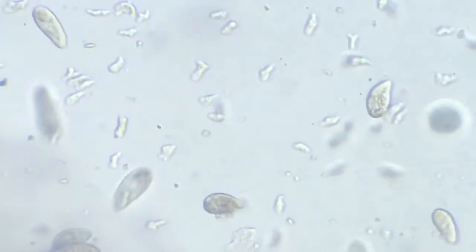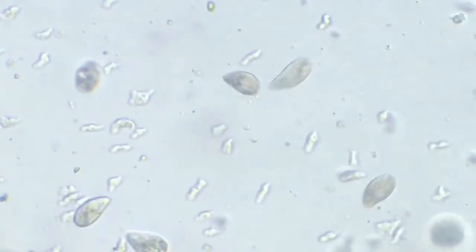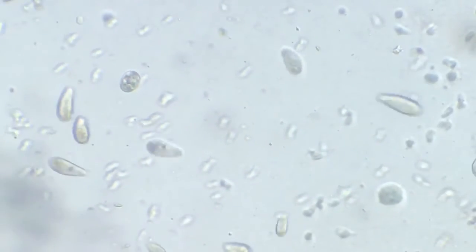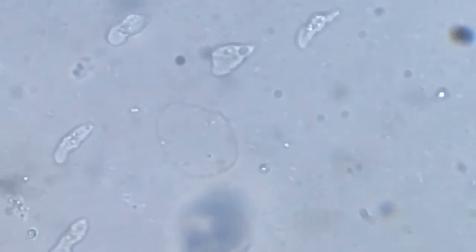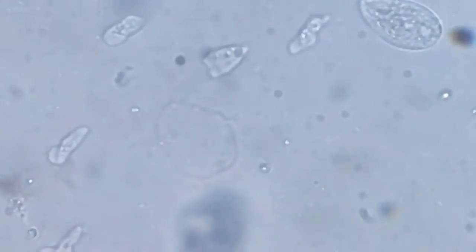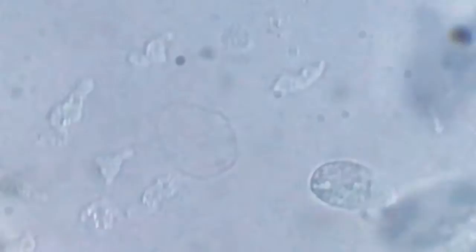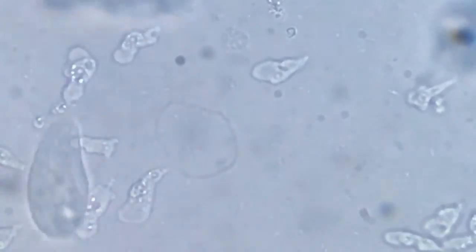So we'll just focus on the amoeba because they look very fascinating and exciting, and see if we can find something worth watching. So we go to the higher magnification now. Need to zoom in, rather focus in fact. So here we have focused and then we see those amoebae. They all seem to be going in a given direction. Maybe their inclination is towards one particular arena.